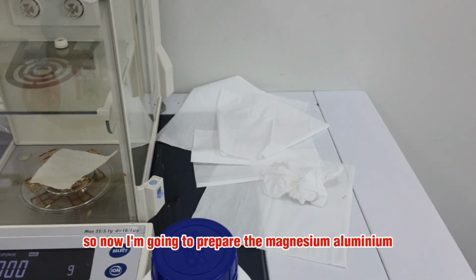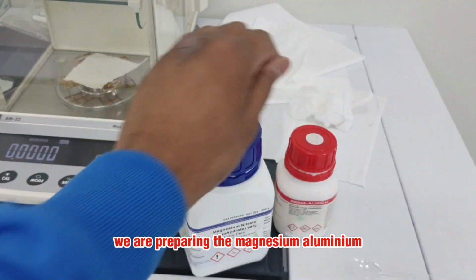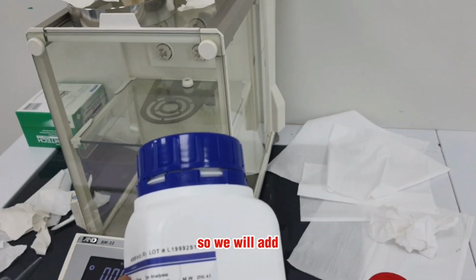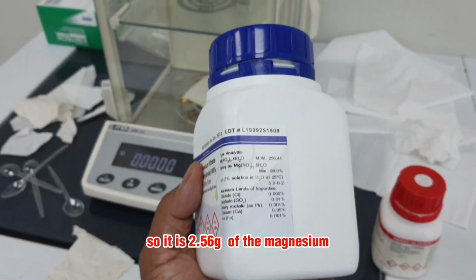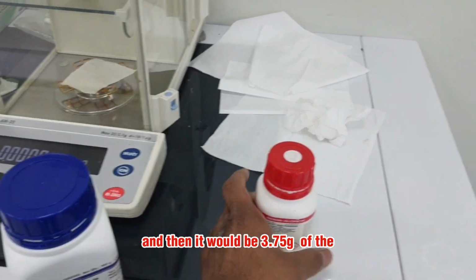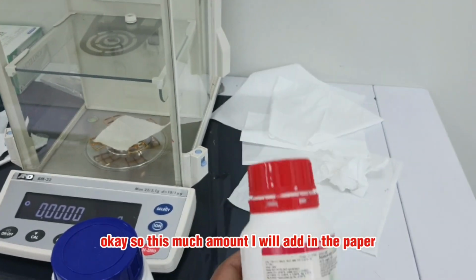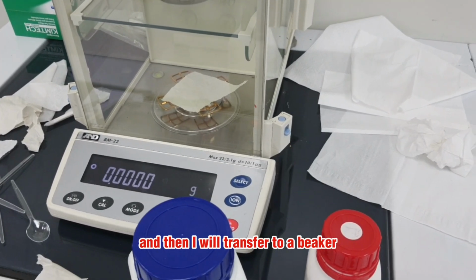Ultrasonicated the biochar. Now I'm going to prepare the magnesium aluminum. Let's suppose we are preparing the magnesium aluminum 1:1 LDH on the biochar. So we will add 2.56 gram of the magnesium, and then 3.75 grams of the aluminum. This much amount I will weigh on the paper, and then I will transfer to a beaker.